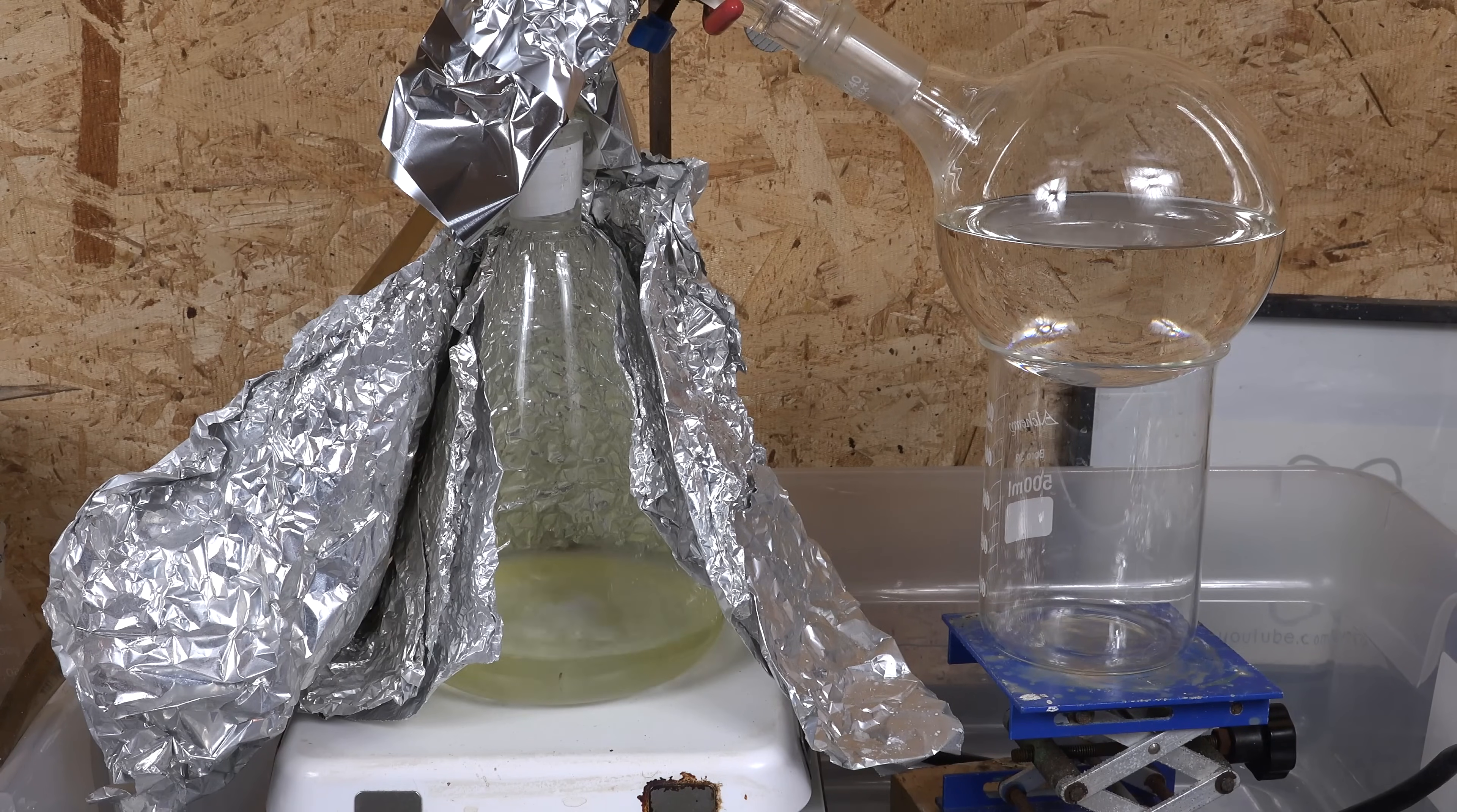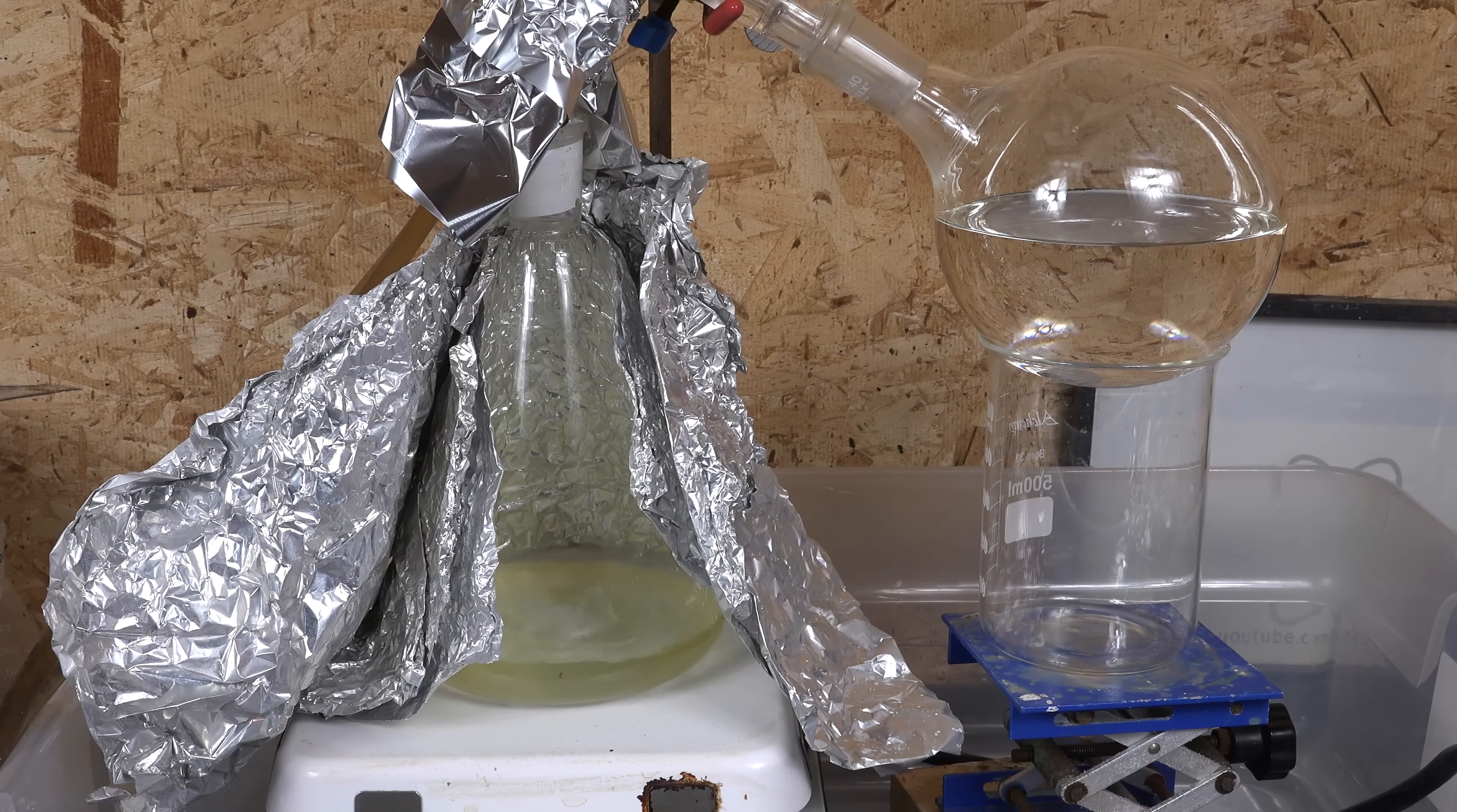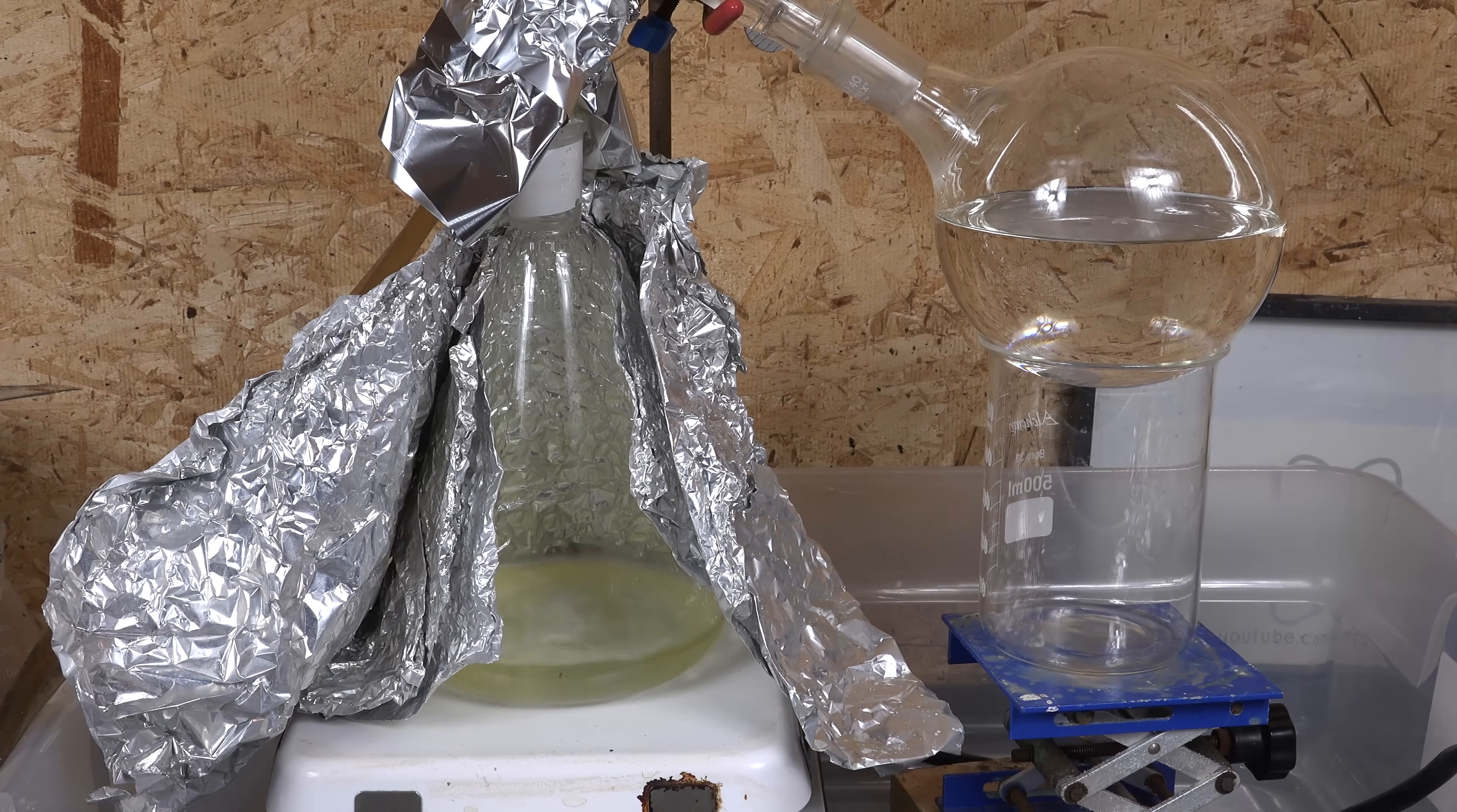Personally, my stir bars have proven completely immune but your results may vary. Some lower grade stir bars will even lose their magnetism at these temperatures. So some amateurs make their own glass encapsulated stir bars from bar magnets and thick glass tubes for their sulfuric acid distillation.